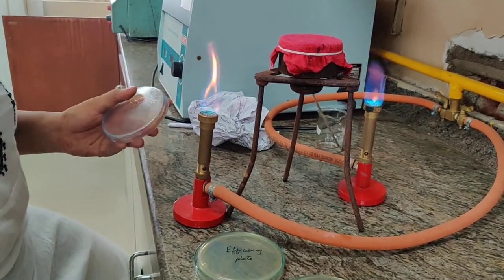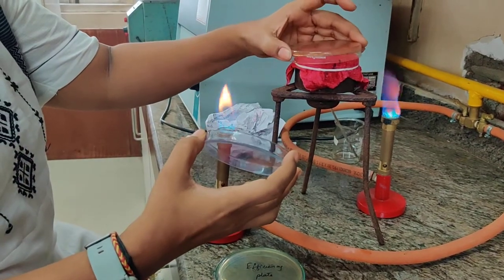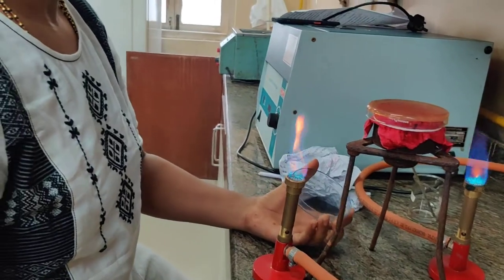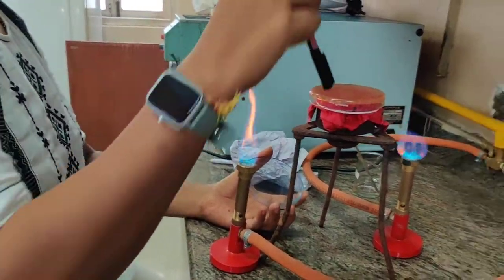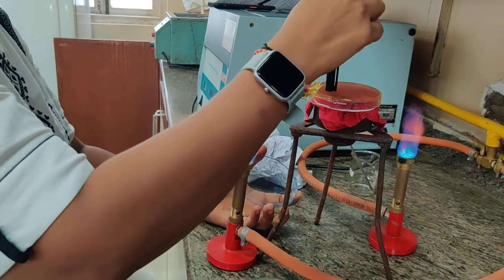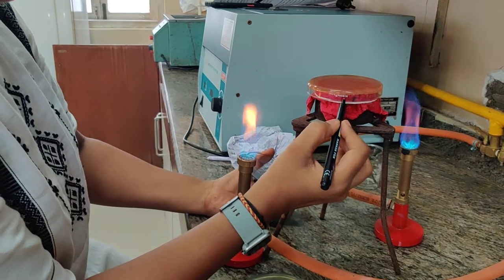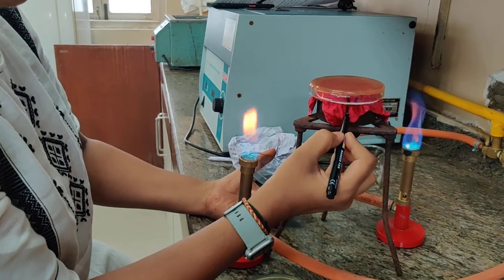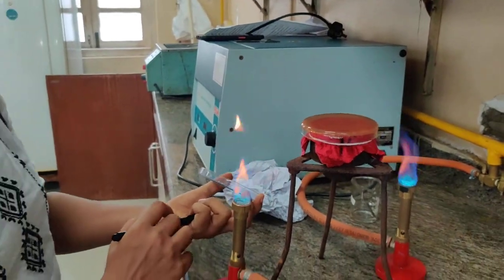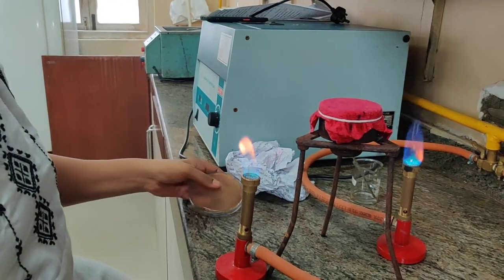After this, we are going to place the master plate — from which we are going to inoculate the needles of the velvet cloth. We are going to gently tap it. A very important thing is to do the marking: we mark the master plate aligned with the marking on the block. This will enable you to match the colonies on the replica and efficiency plate after incubation.